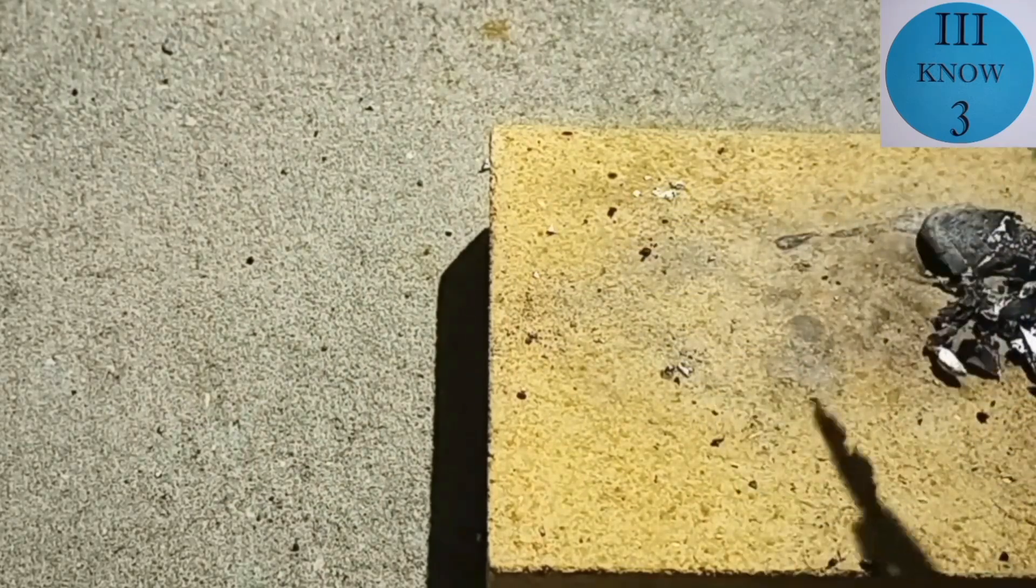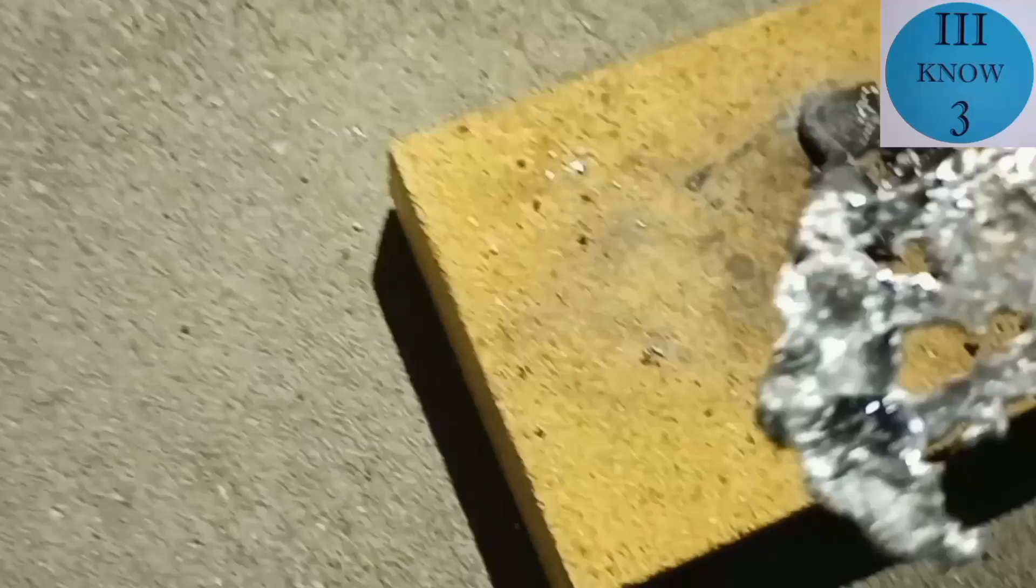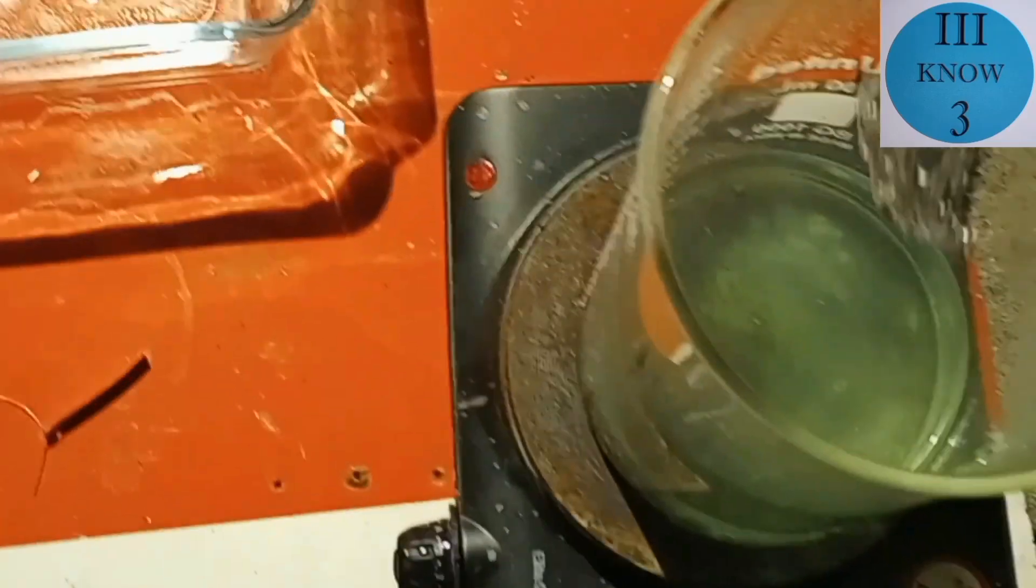This piece looks like the biggest and it looks like there's the most zinc exposed on this one. The others have a lot of nickel on the outside so we'll take this one over and drop it into the solution.